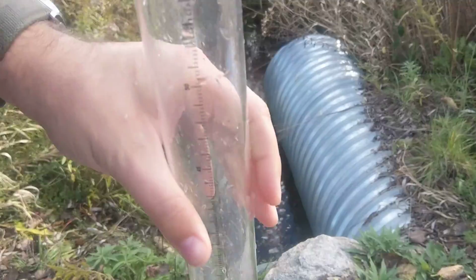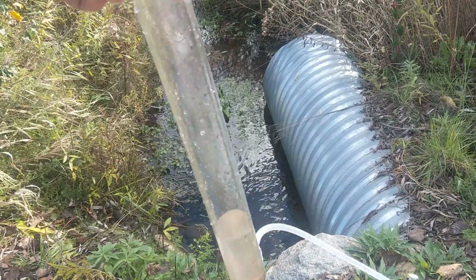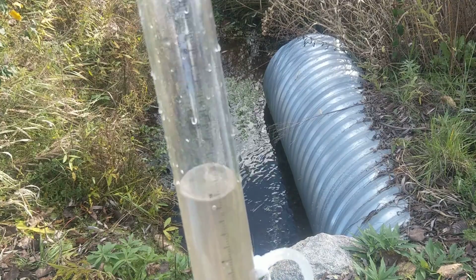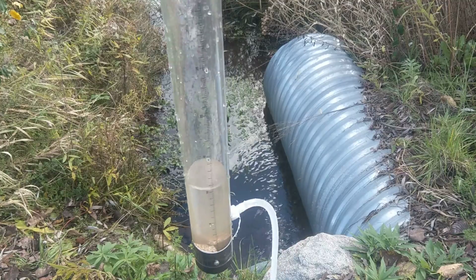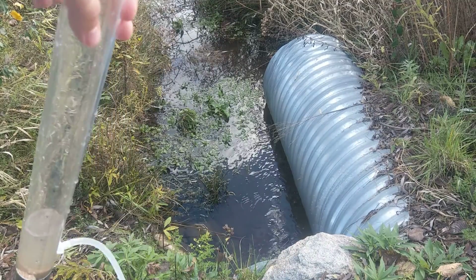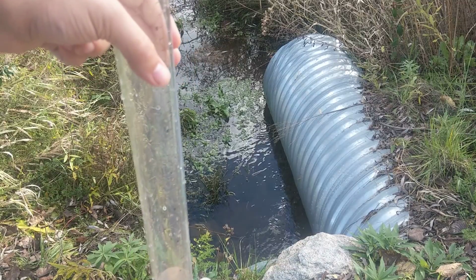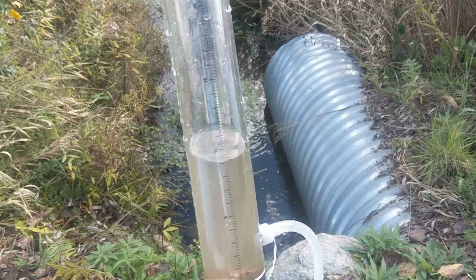So you can see just that act of stirring things up on the bottom, just by even pouring the water out, was able to make the water silty enough that it got to a value that is not so good. So making sure that it's in the undisturbed area is key to getting accurate results. But that is how to use turbidity.